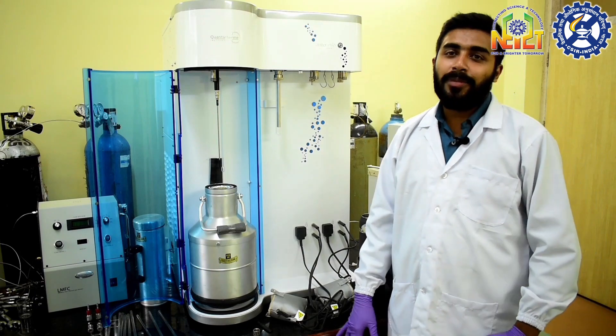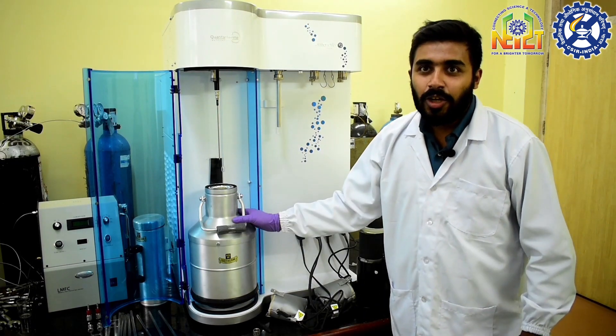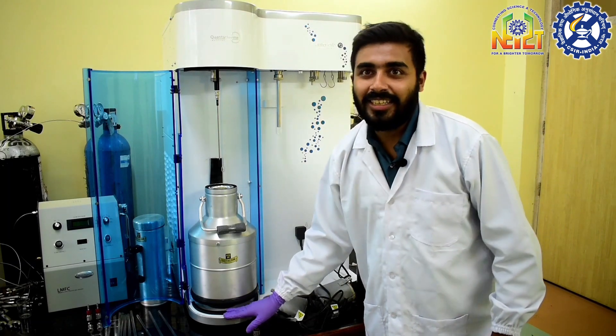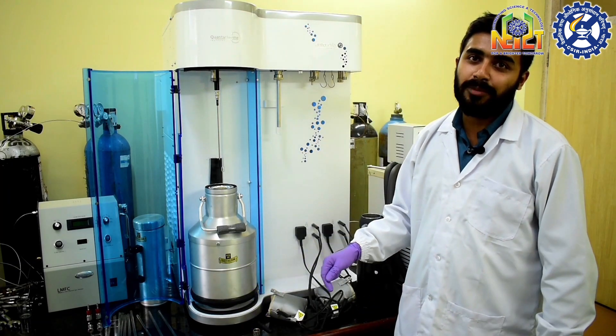The Autosorb IQ instrument is supplied with a 3 liter dewar flask which is placed in the lift base. The dewar flask contains the coolant which is basically liquid nitrogen.